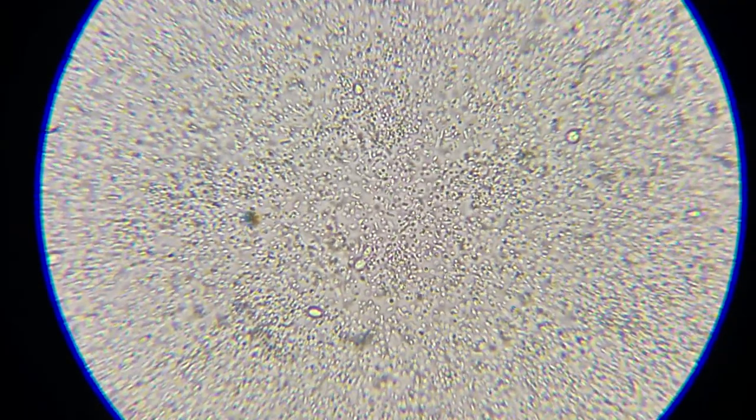Lo and behold, this is just filled with tons and tons and tons of bacteria. But yeah, I see some rod-shaped bacteria, so some Lactobacillus bacteria there. However, Gluconobacter can also have a little bit of a rod shape to it. That's an acetic acid bacteria, so.